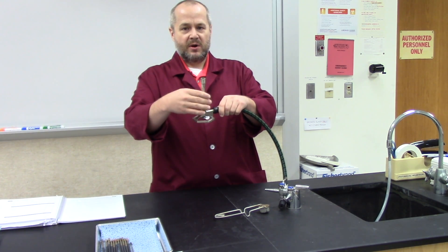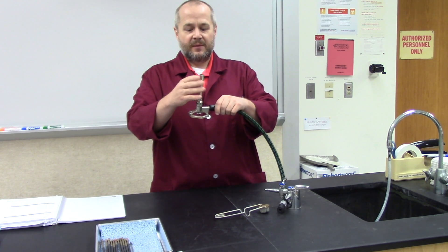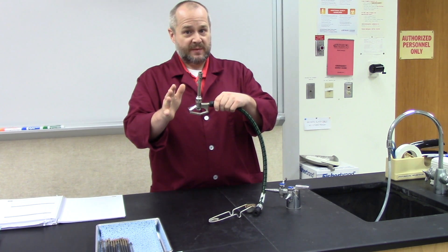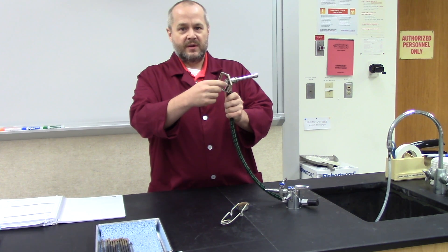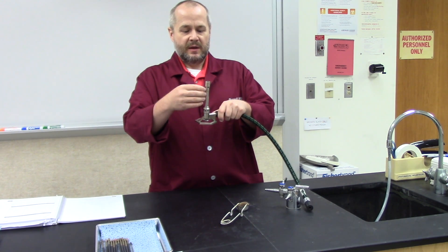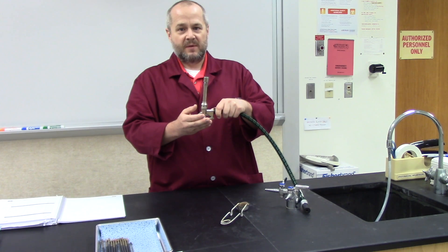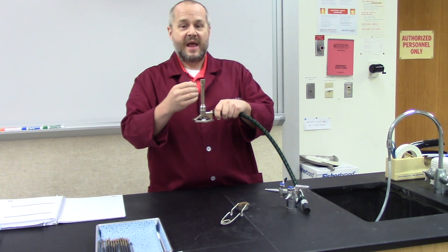The second thing is to take the barrel of the burner and turn it all the way clockwise as well until it stops. Don't overtighten it because you'll have to loosen it again. Now I've taken all the air away from the Bunsen burner — no gas, no air can get to the combustion chamber; this burner will not light. To use it, take the needle valve and turn it two half-turns to the left — now we've controlled the amount of gas going to the burner. Do the same for the barrel — two turns to the left — allowing some air in. This gives a controllable flame that will more than likely be yellow and easy to see.